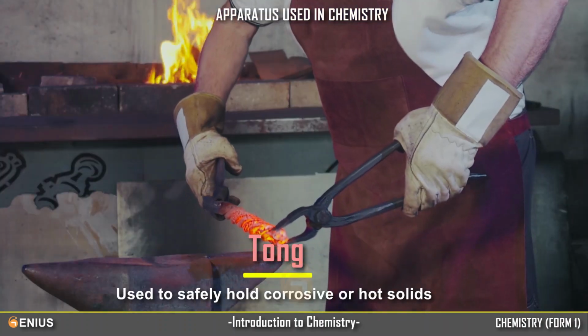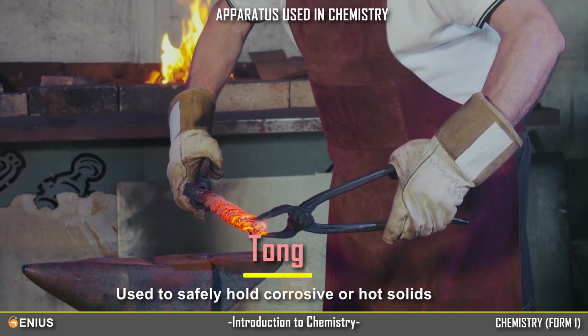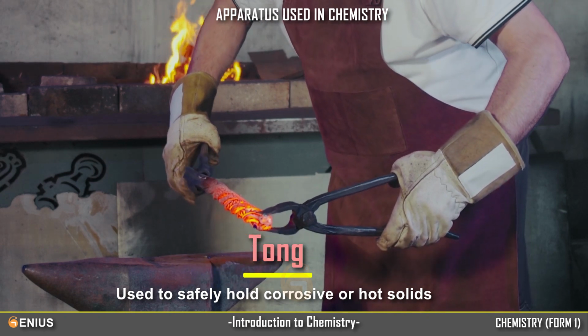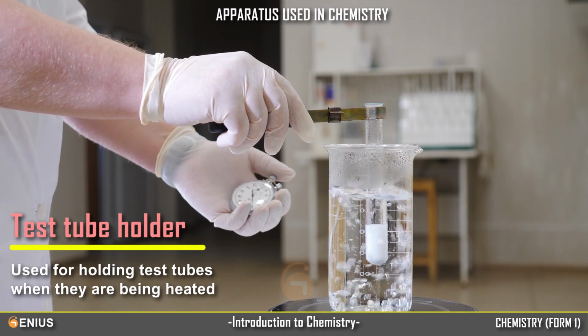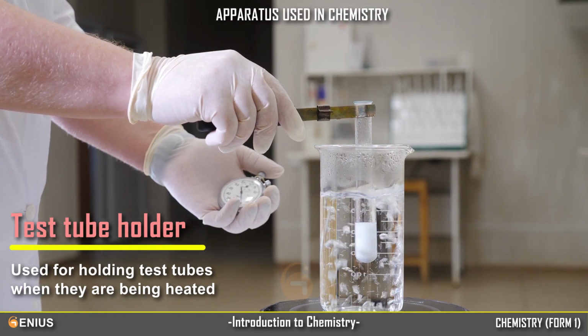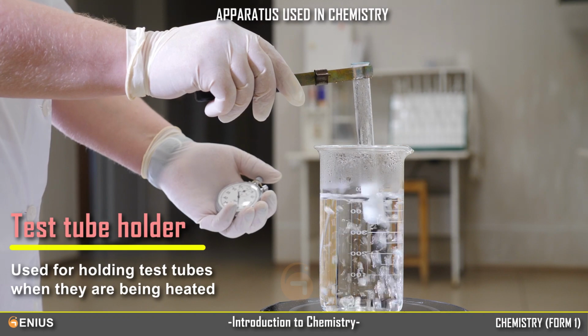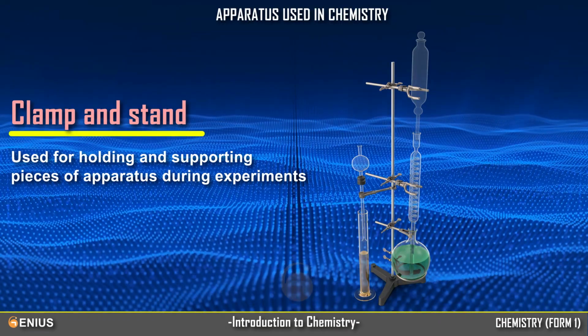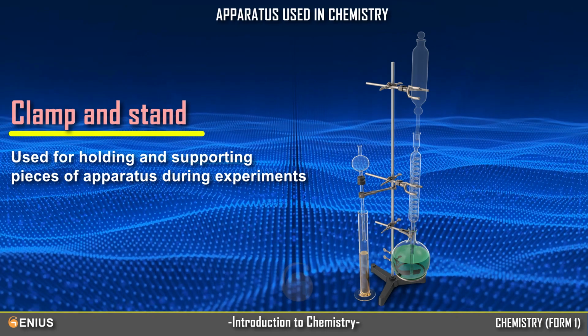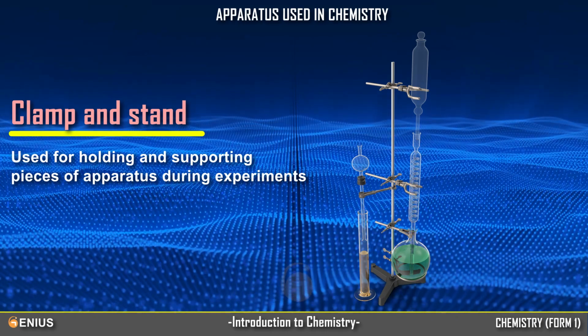Tong. Used to safely hold corrosive or hot solids. Test tube holder. Used for holding test tubes when they are being heated. Clamp and stand. Used for holding and supporting pieces of apparatus during experiments.